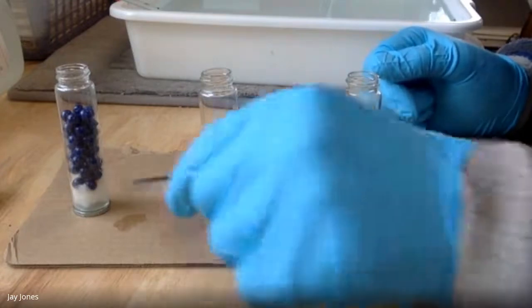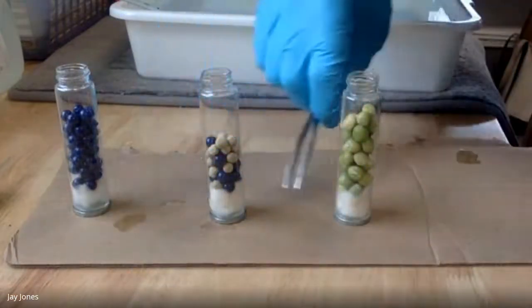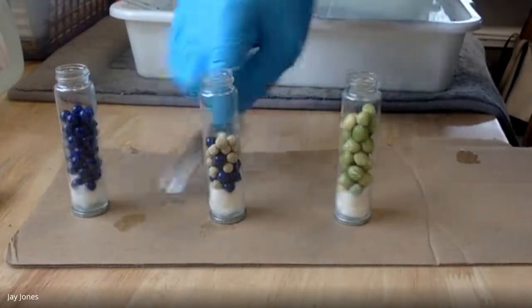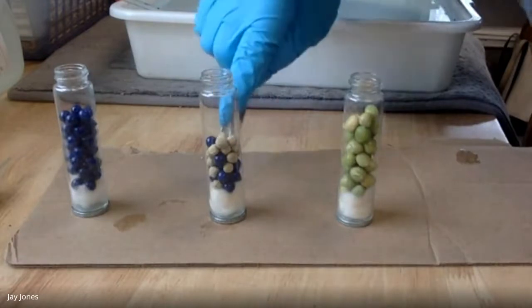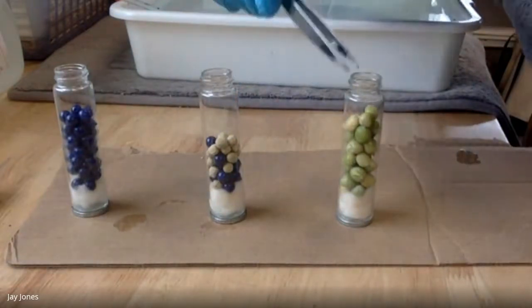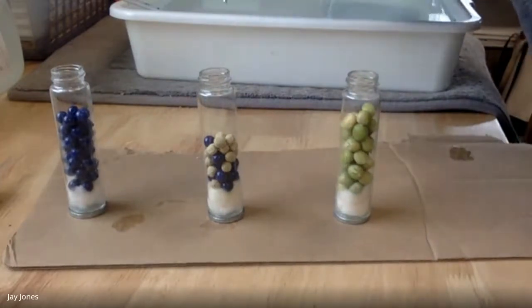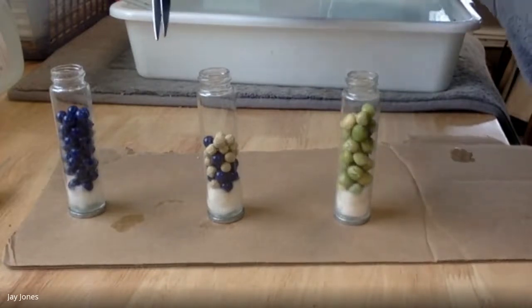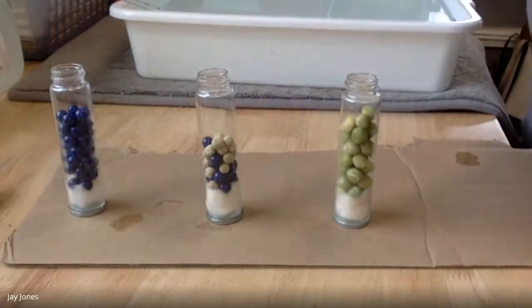All 3 have KOH, potassium hydroxide. The potassium hydroxide is there for a very, very important reason. As you guys know, when anything performs cell respiration, what is produced? Anybody want to participate? I know you're on video. Very good. Carbon dioxide. Carbon dioxide's made.